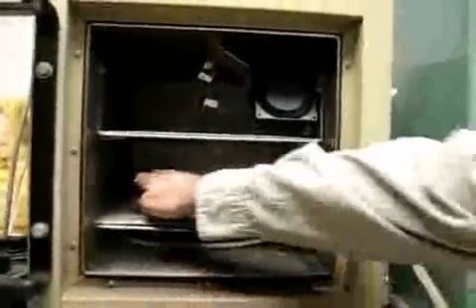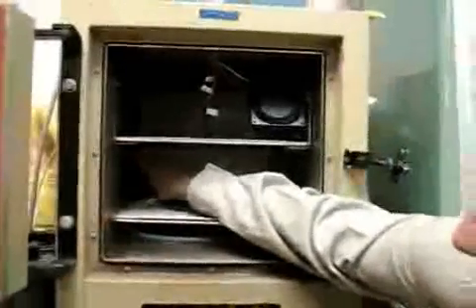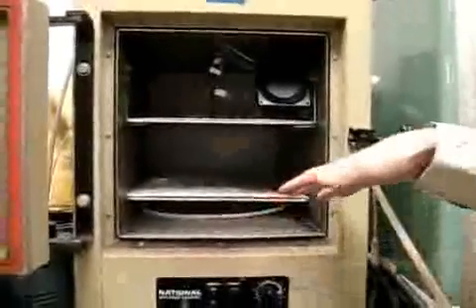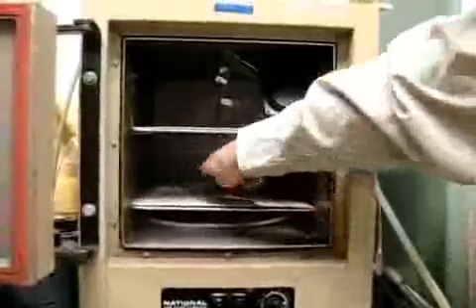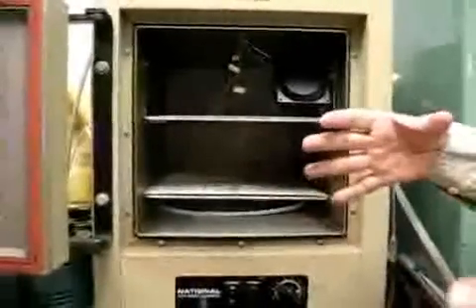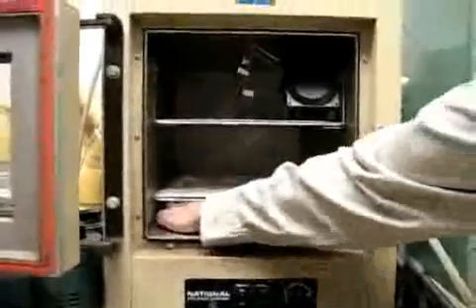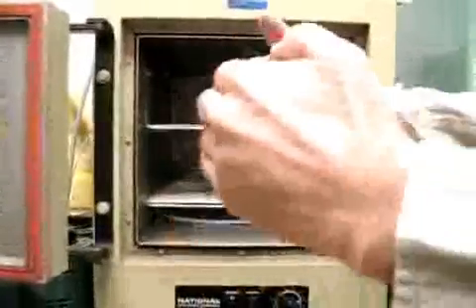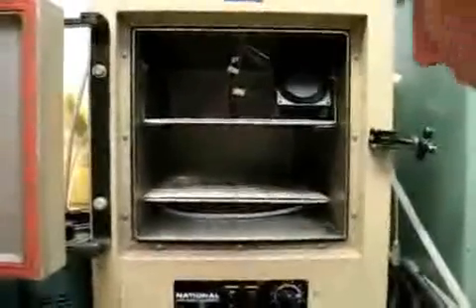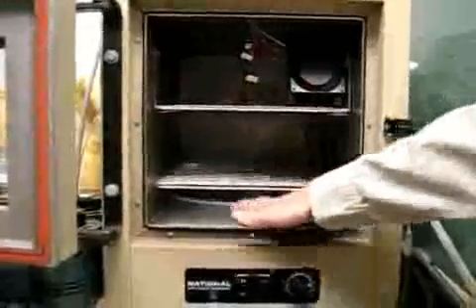This is where the humidified and heated air comes into the furnace, and then it enters this ring at the bottom of the furnace that has a series of 1/8" holes drilled 3 inches apart around the ring. We grossly measured the flow out of each of these to be even. In other words, there's not significantly more flow on this end than on this end because of the loop design. It goes into a T and goes out like that, not just going to an end, which would tend to produce more flow out of the initial ones. And again, that's not even terribly critical, I don't think, but it's good to start out with that evenly.